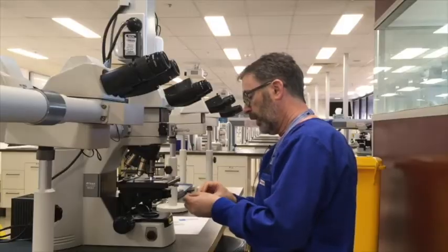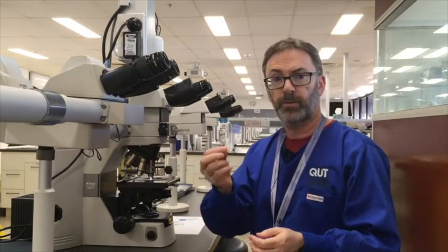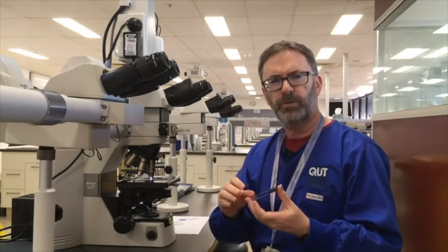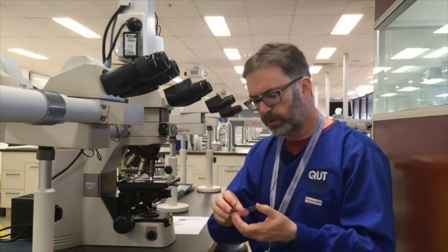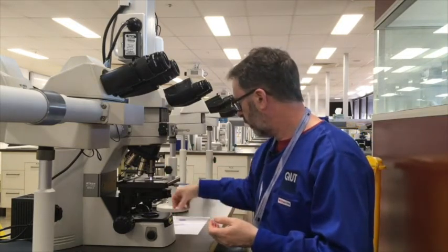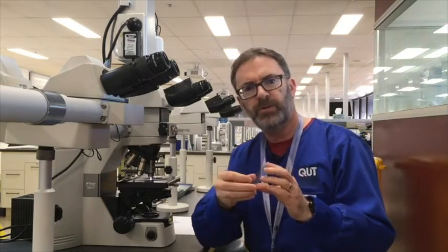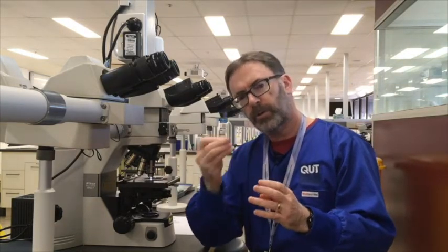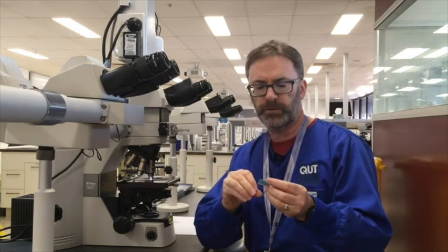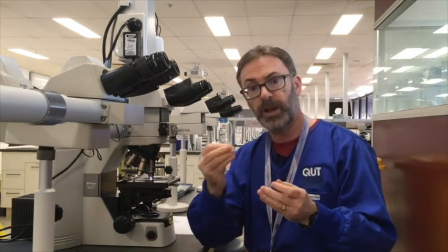Okay. Now, because we often try to interpret the outcomes of a H&E based upon the final product, it can sometimes be quite difficult to learn the process without being able to see both those stains separately. So we have in the laboratory some example slides which demonstrate the various stages of Ehrlich's hematoxylin being applied to a slide. So the first one is after 10 minutes in the hematoxylin, the slide has been rinsed to remove the excess stain, and then it's been blued, as we say, with the dilute ammonia to bring out the right colour.